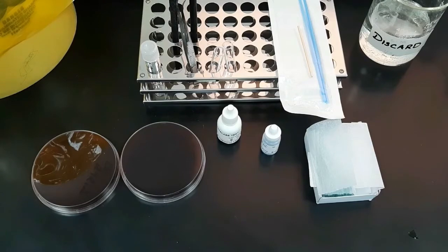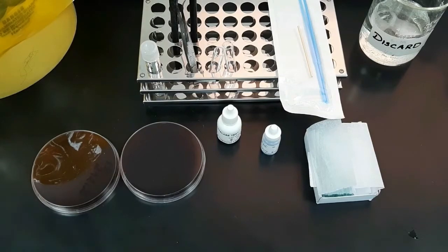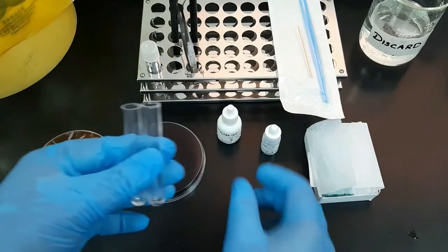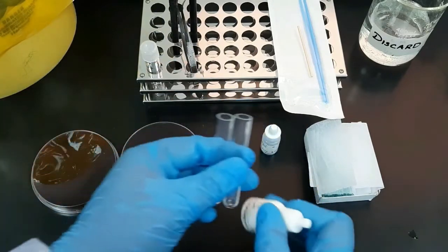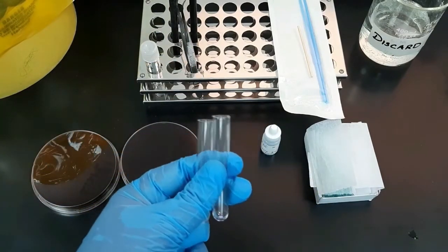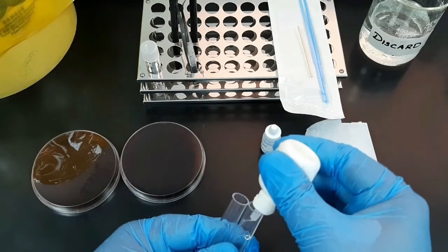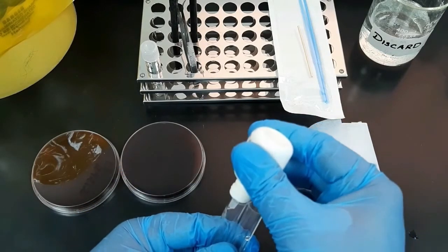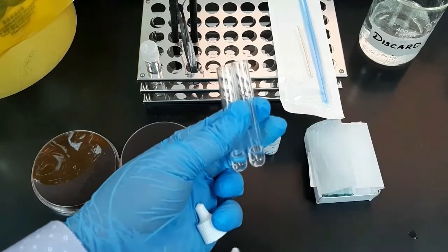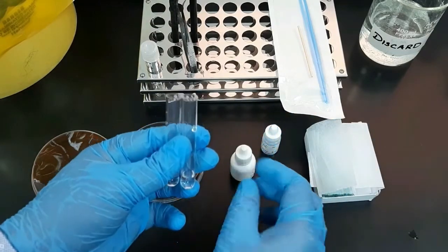Now I will show the tube method. Here also I am using two tubes — one for the positive control organism and another one for the negative control organism. Transfer 0.5 ml of catalase reagent into both tubes, and when performing the test always remember to mark the tubes.